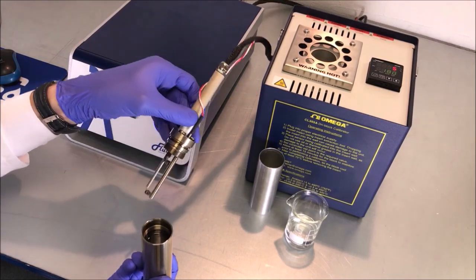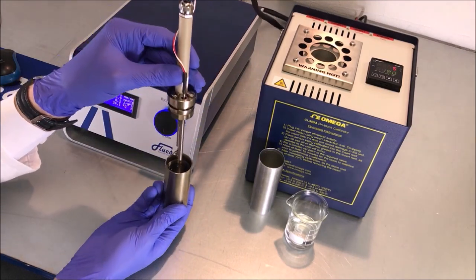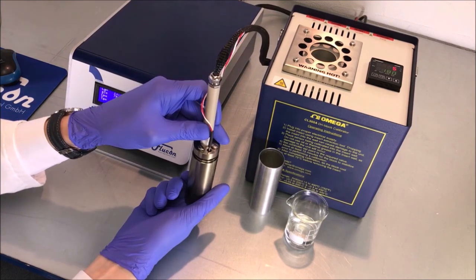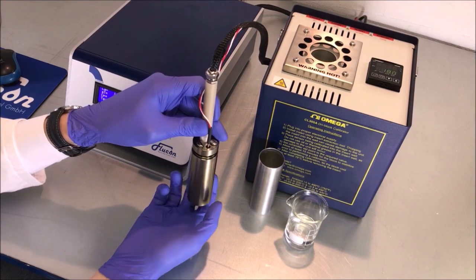Grab your Lambda sensor and immerse it gently into the sample. Screw on the cup with slow and steady turns.